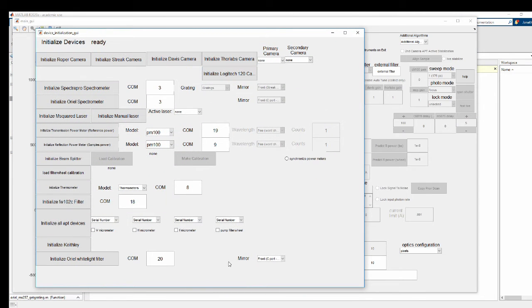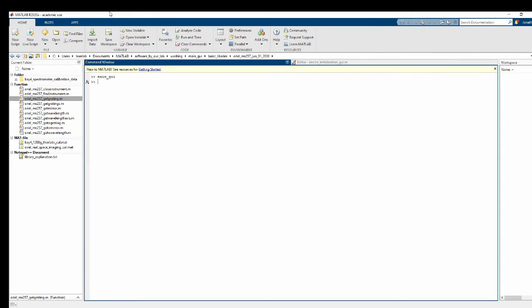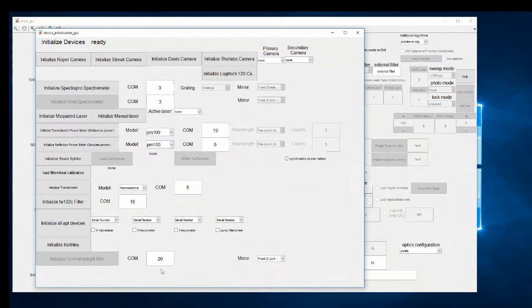All right, it's on COM20. All right, check MATLAB for any warnings. Nothing showed up. All right, and so right now it seems to say that it's outputting to the Thorlabs camera. I want it to output to the white light filter. So I'm going to select that. It's working. It's rotating the exit mirror now.